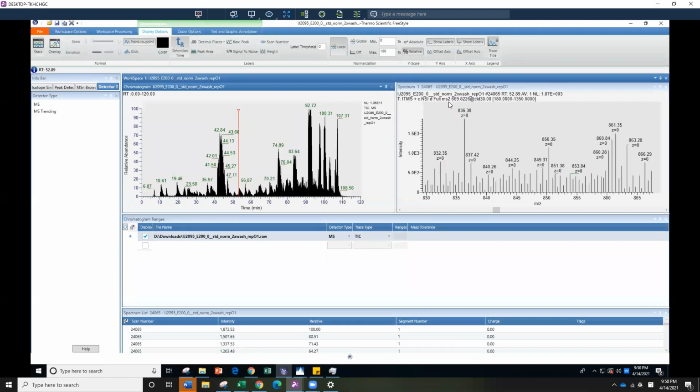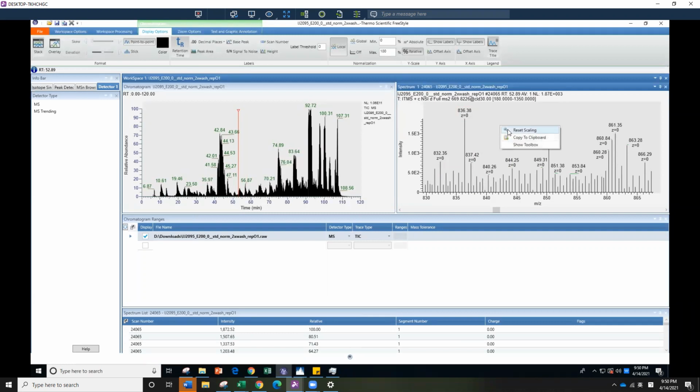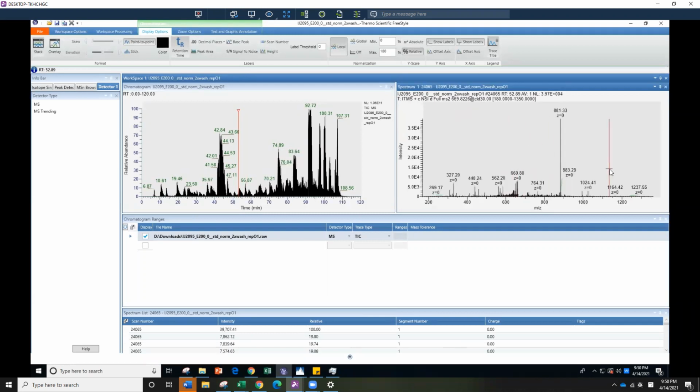And it is an MS2. It looks like it is zooming. Okay, so now it's not zooming. Oh yeah, it was because I had zoomed in on the MS1. This full spectrum, we selected from 180 to 1350. That's your MS scan m over z scan range.